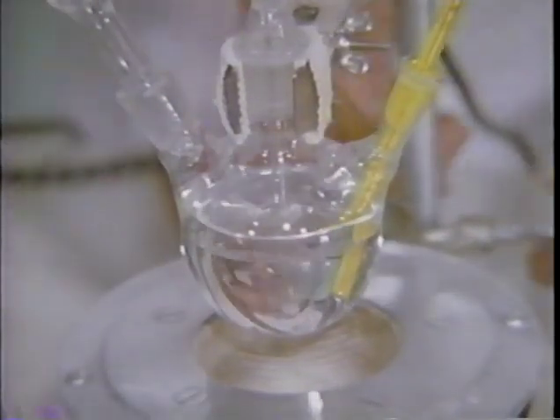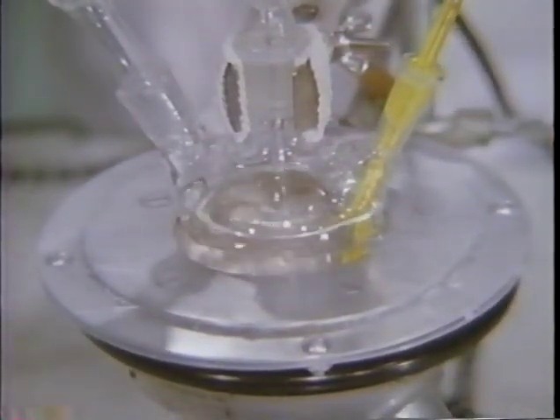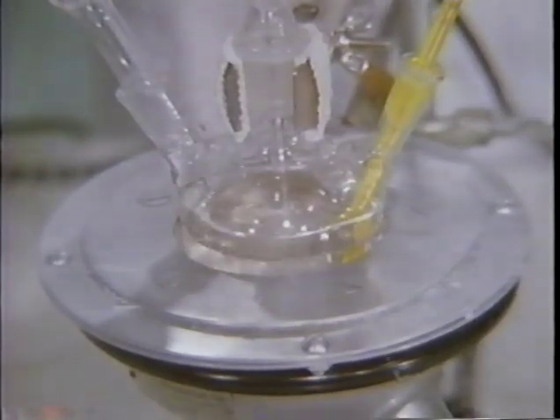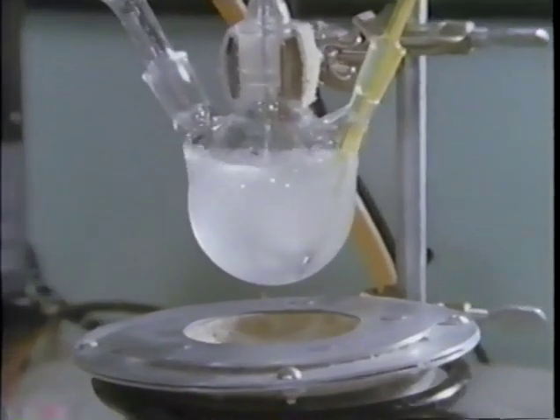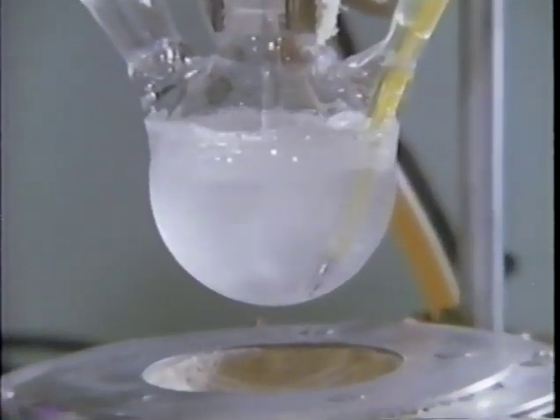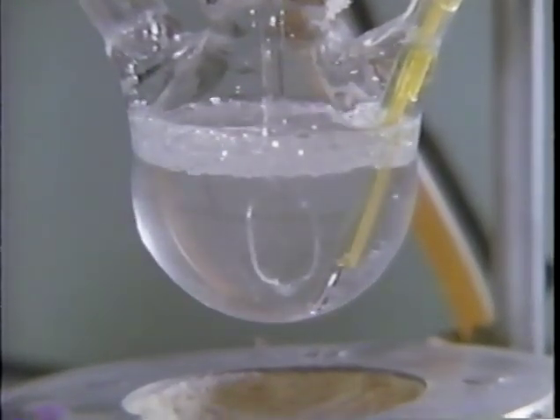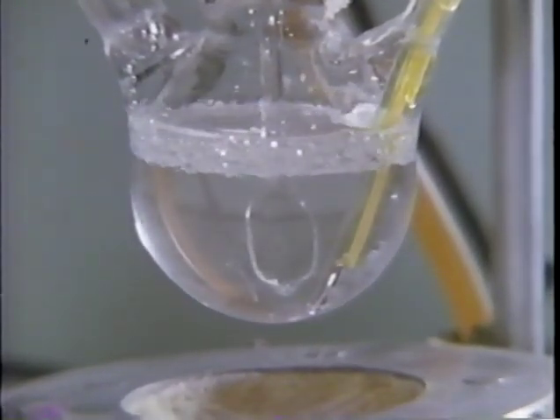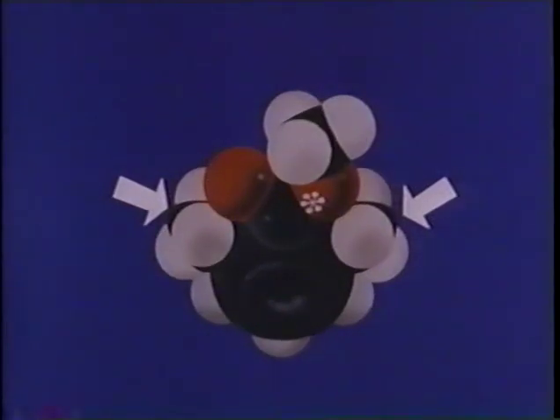We'll test this idea by heating the new ester, methyl 2,6-dimethylbenzoate, in the presence of aqueous sodium hydroxide, repeating the original conditions. After stirring and heating for 8 hours, no detectable reaction has occurred. There are still 2 layers, so this experiment further confirms our proposed mechanism. Since no other suggested mechanism fits all our observations, we assume the proposed mechanism is the true one. Seemingly, these bulky methyl groups have greatly hindered the reaction.